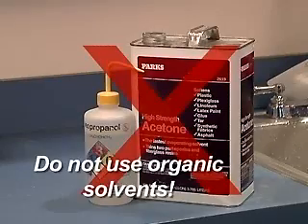Do not use organic solvents such as methanol or acetone to clean the sensor. These chemicals will damage the plastic components of the sensor.